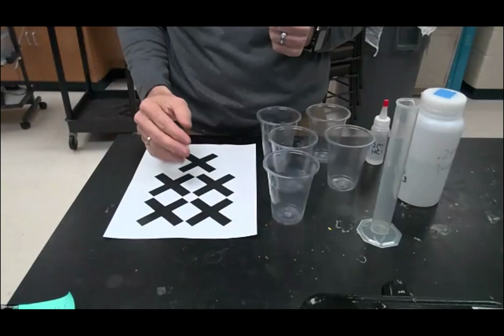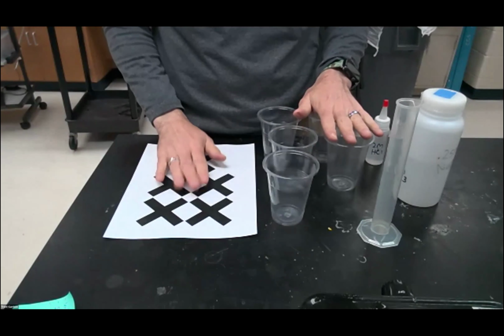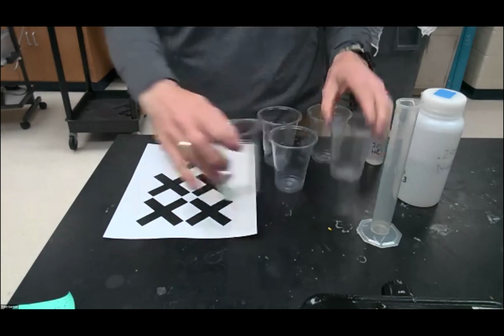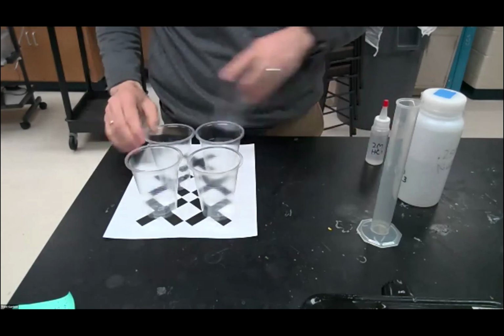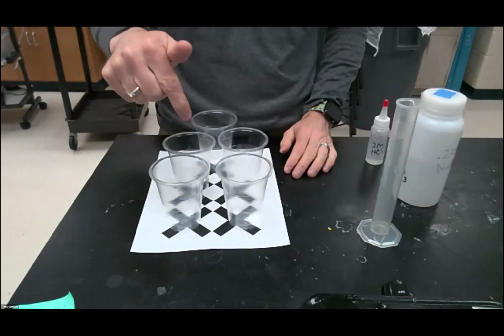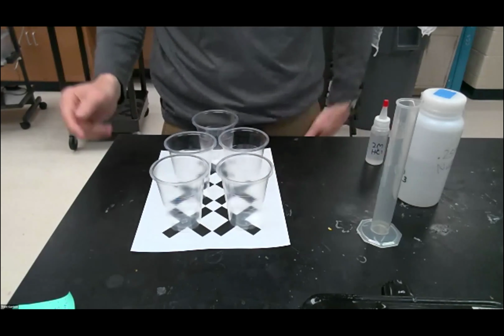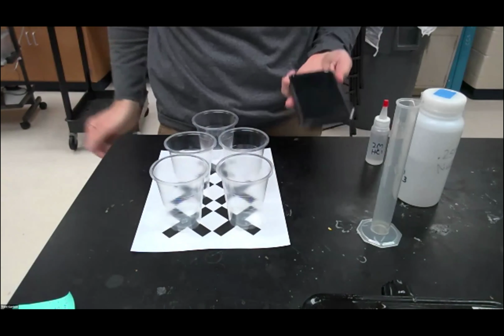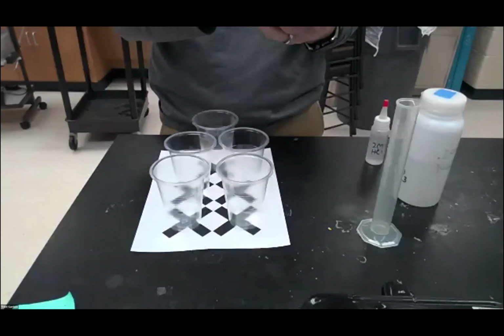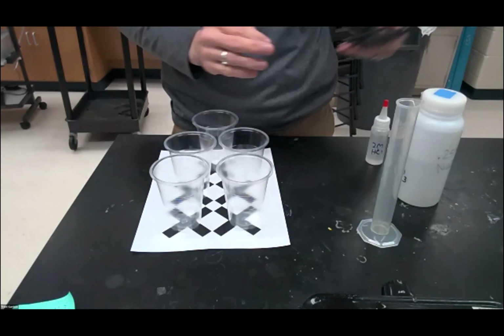Let me share with you my other camera, and we'll get going. Okay, so what you see in front of me on the desktop here are the 5 glasses that we're going to use for the 5 different concentrations. You see a table that has a bunch of X's on it, and we would be placing those 5 cups onto the X's, and we're going to watch as the X's disappear once the reaction occurs, but they're going to happen at different rates, so we have to set a stopwatch or use your phone to try and time this scenario. So I will get my phone up and running here so that we have a stopwatch and we will be able to time once we get ready.